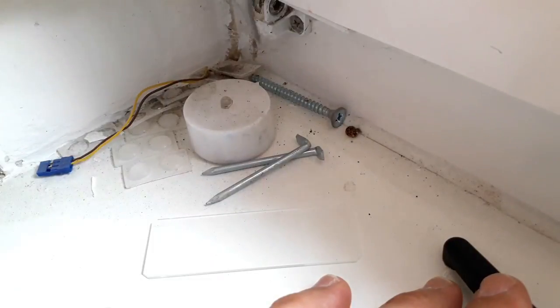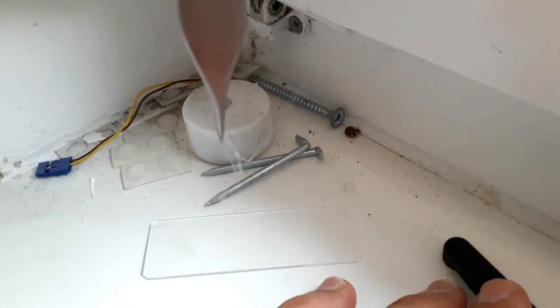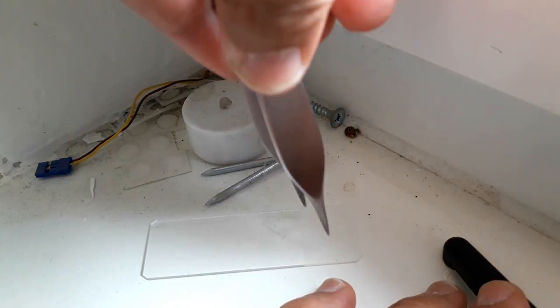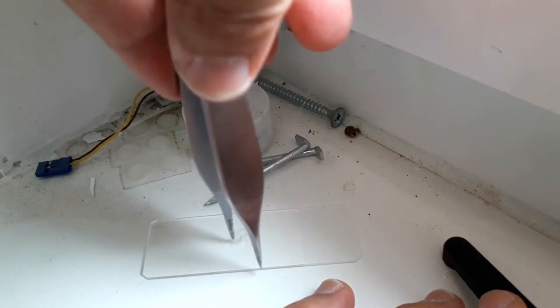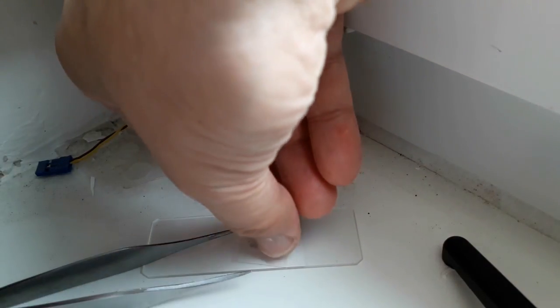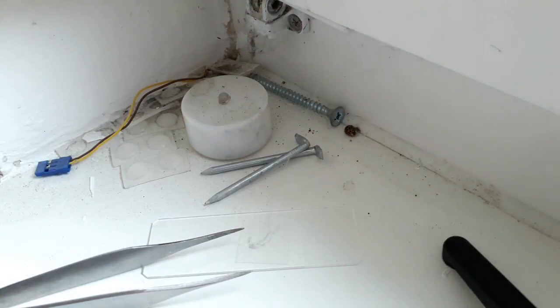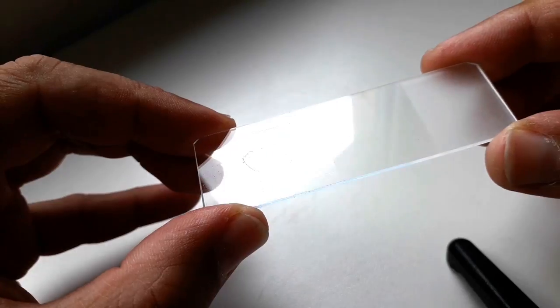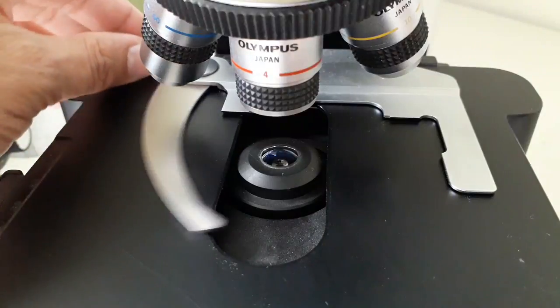Well, I think I haven't cleaned this place for at least two years. I've simply forgotten about it, but that's a good thing actually because it's now the habitat of a spider and this spider made this little cobweb. Now I would like to put it under the microscope to determine how thick the web actually is - well, actually not the web but the individual fibers, the silk fibers.